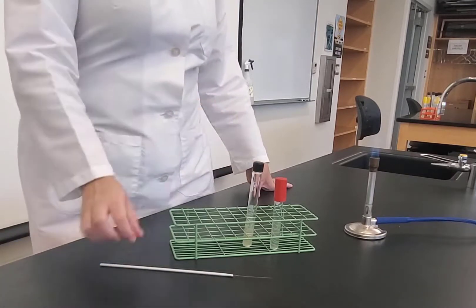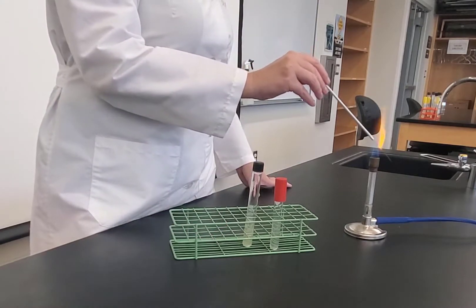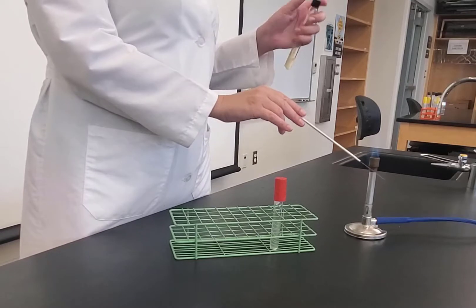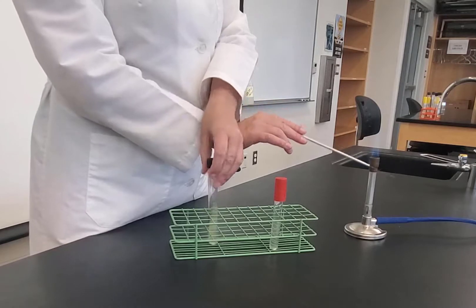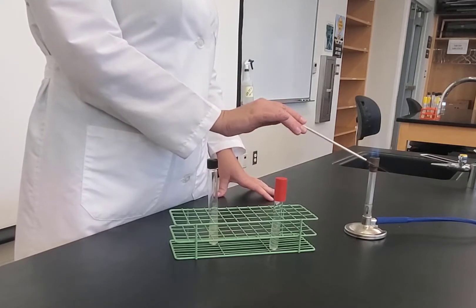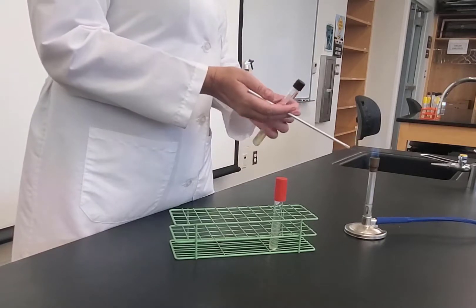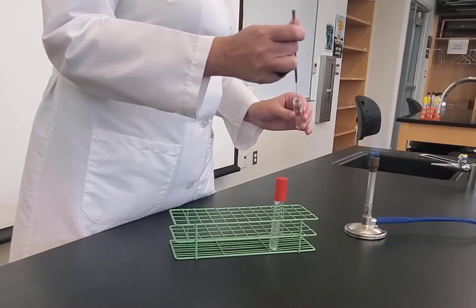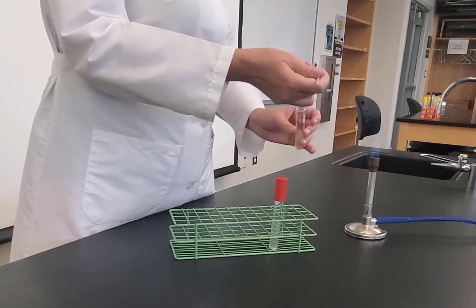I would label my tube. I have my needle, and I'm going to take the needle and flame sterilize it, and let it cool. While it's cooling, I'm going to open the screw top. The one that I have for this demonstration is E. coli. But again, there would be four of those tubes that you would inoculate. I'm going to take the cap with my pinky and ring finger, flame, go in and pick up some bacteria from the slant, come back out, and cap.